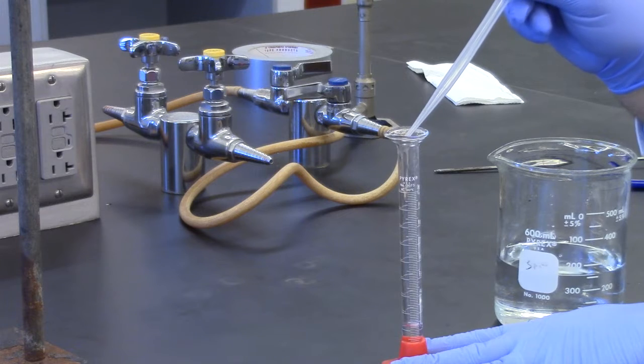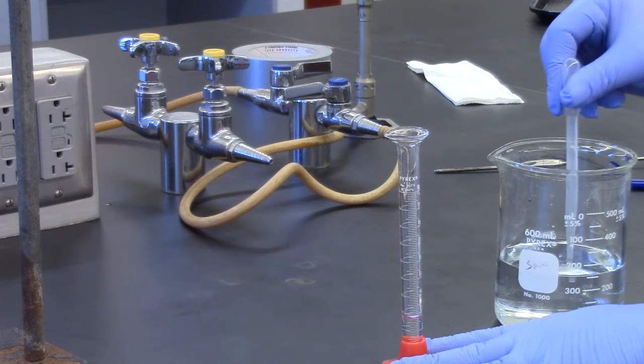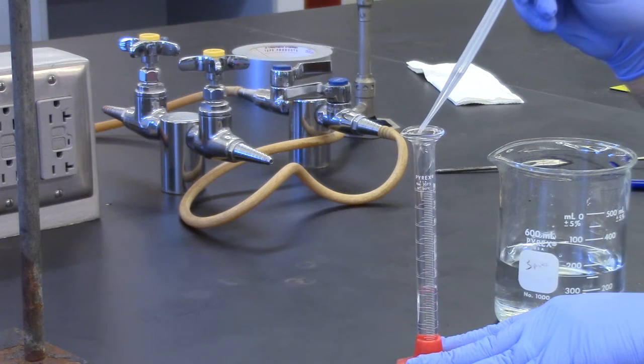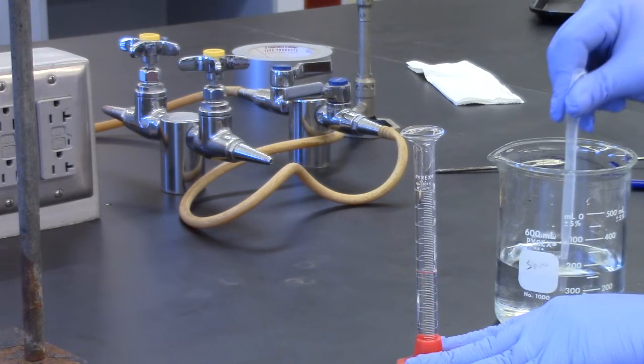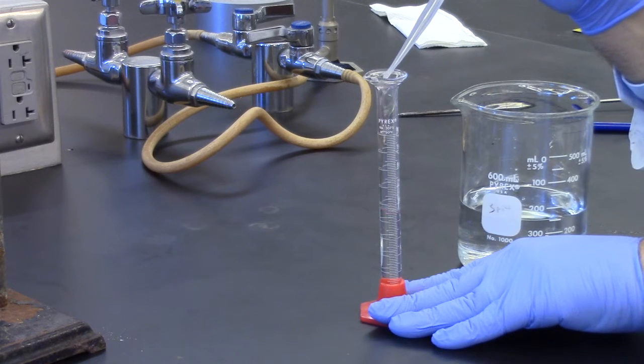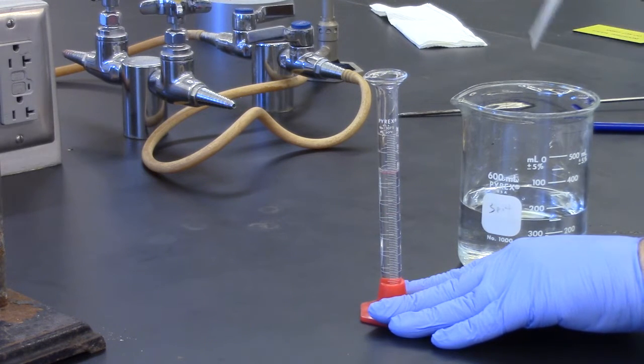Using a 10 milliliter graduated cylinder, add distilled water to the 10.0 milliliter mark.